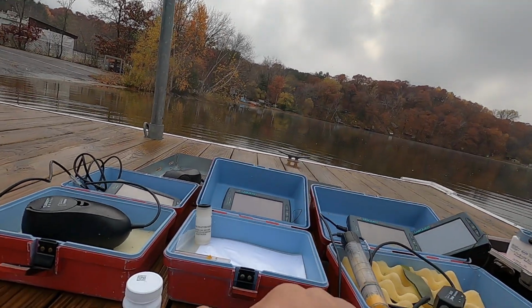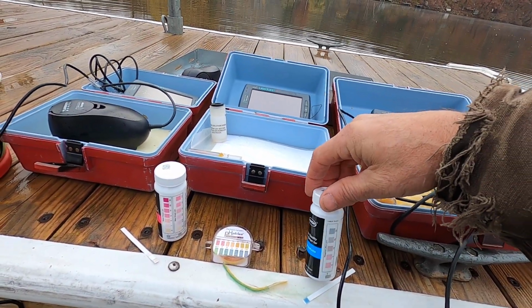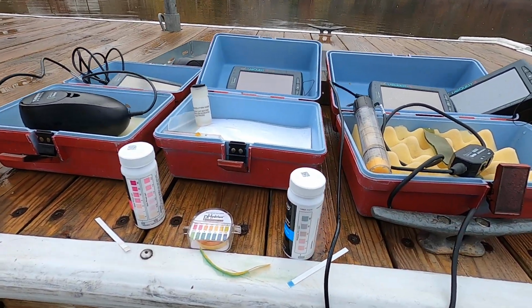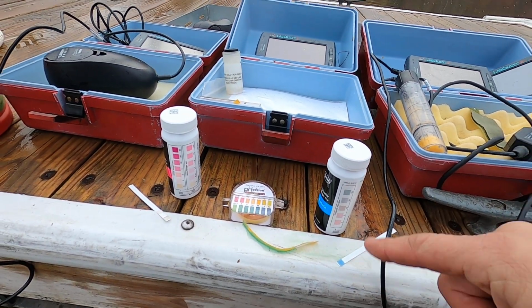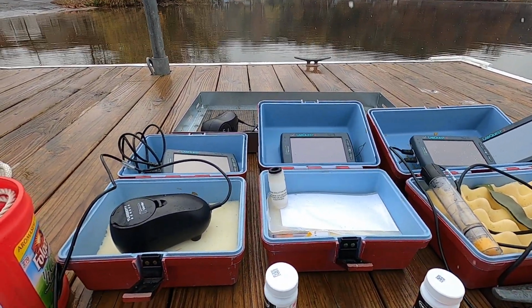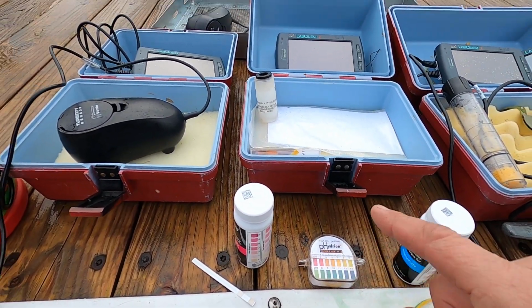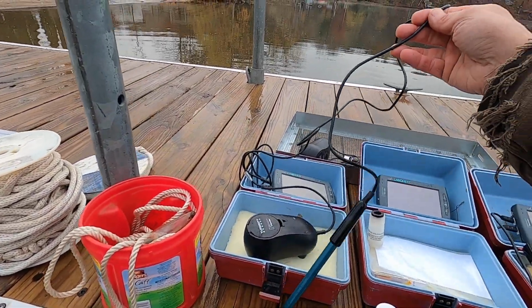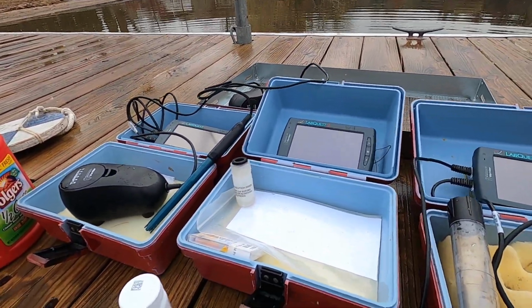But anyway, we have a 0 reading for nitrogen, and in phosphorus, this test has been sitting out for a while. So it has gone from 0, or a pink color, to blue because it's sat out in the air. It's oxidized. So anyway, nitrogen and phosphates 0. pH is also measured here. I tried to do this as a demonstration, but we can use litmus paper, and the pH was 7, and I have a pH probe for our LabQuest, which also read 7. So I'll let you decide what that all means, but a pH of 7.